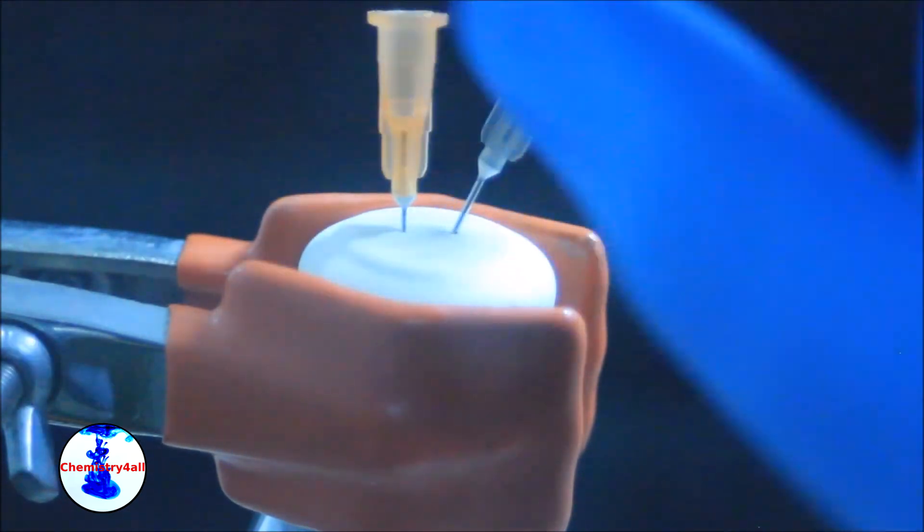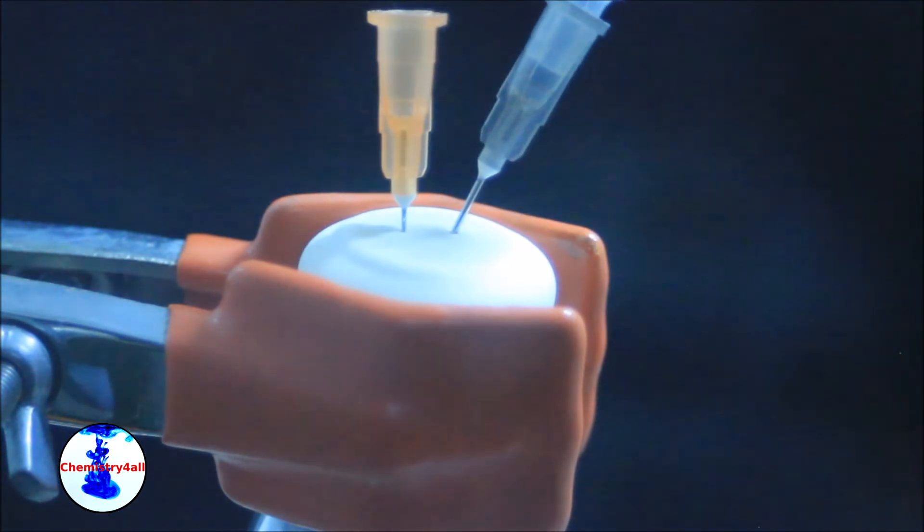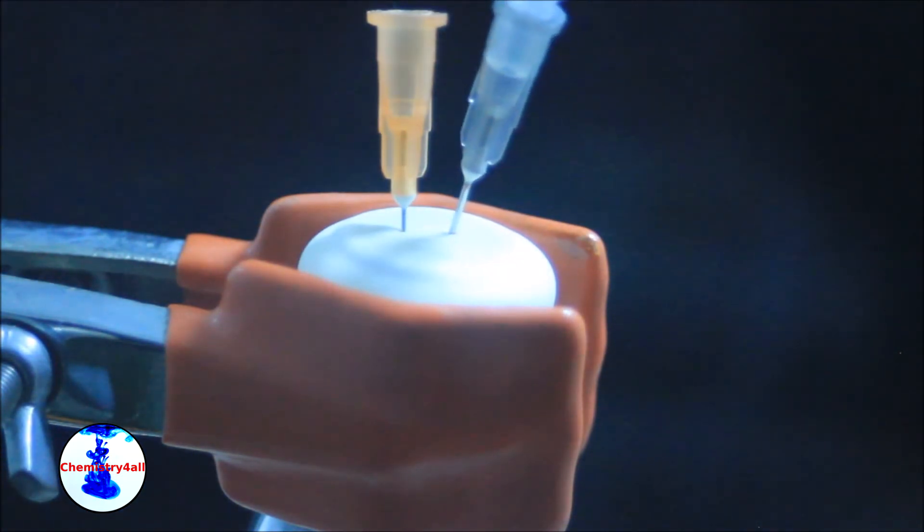Once all the argon has been consumed, the needles can be removed. Now our system is perfectly dry and under an inert atmosphere.